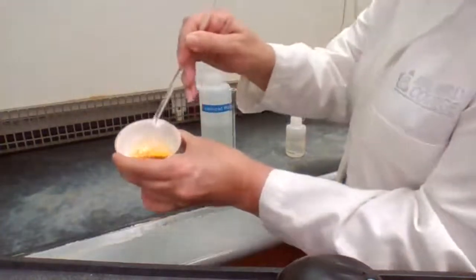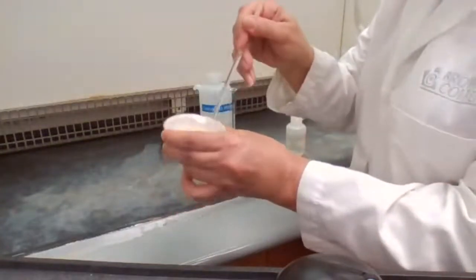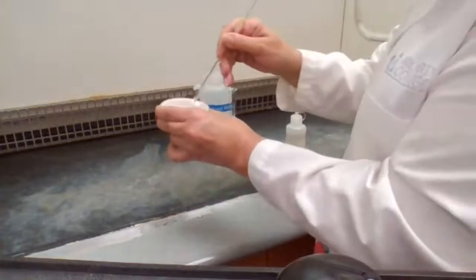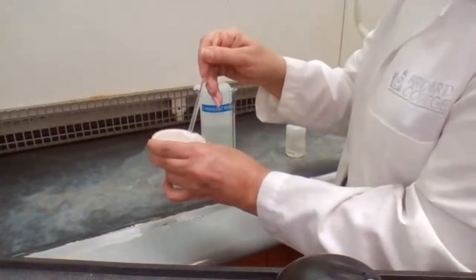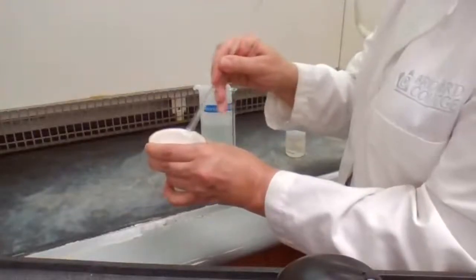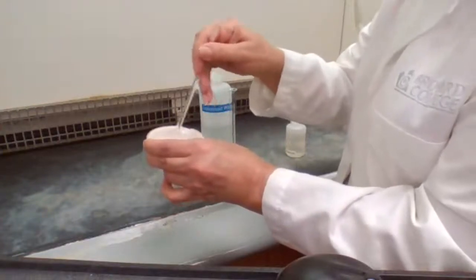Okay. It's still too dark. Too dark. The reaction is not complete. You can see that. And I'm going to give more time for this reaction to take place. It's better always to read the experiment completely and understand the procedure before you come to the lab, so you can actually use the time more efficiently, and you would go prepare equipment and chemicals for the next steps.